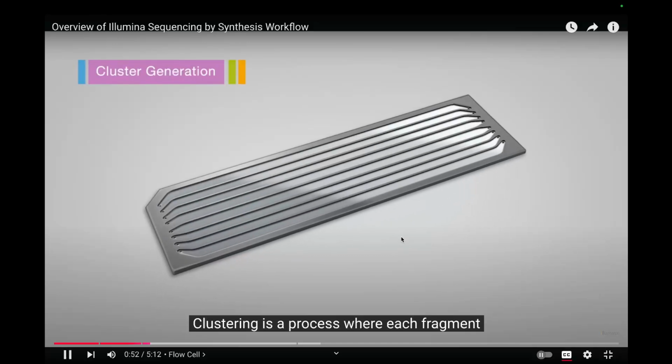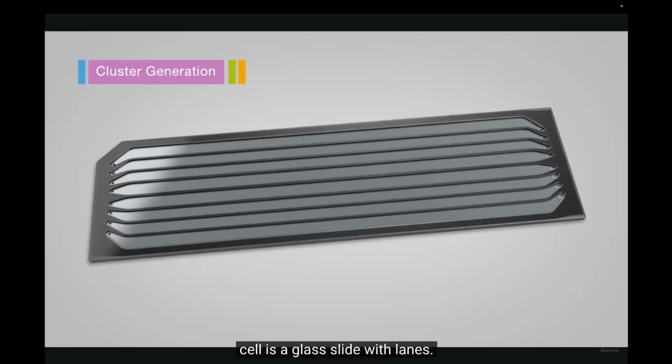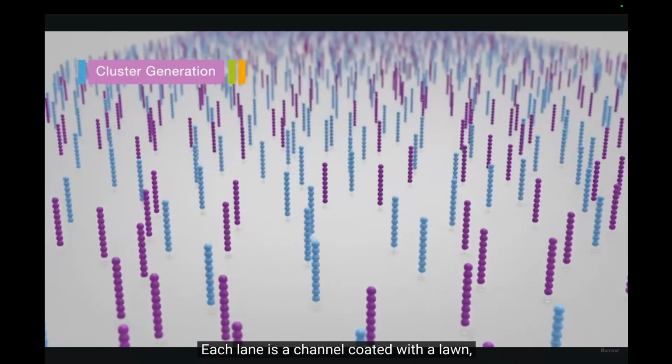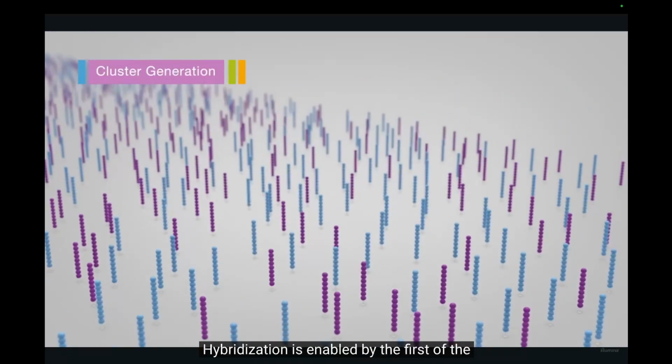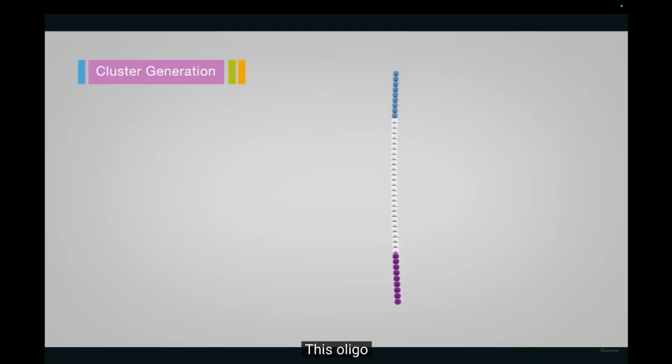Clustering is a process where each fragment molecule is isothermally amplified. The flow cell is a glass slide with lanes. Each lane is a channel coated with a lawn, composed of 2 types of oligos. Hybridization is enabled by the first of the 2 types of oligos on the surface.